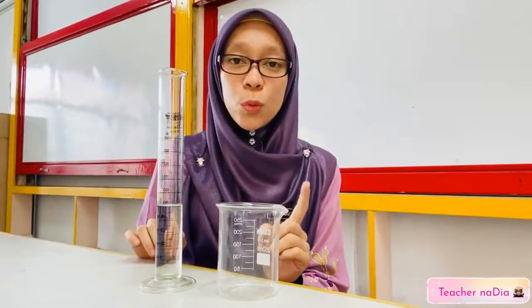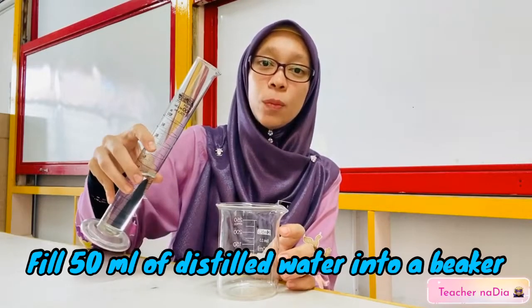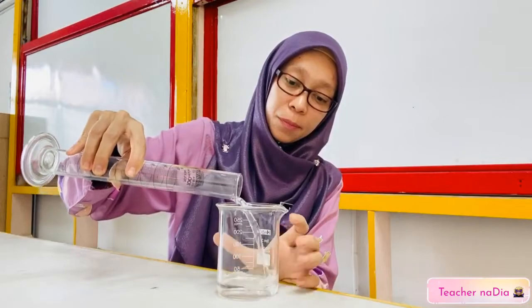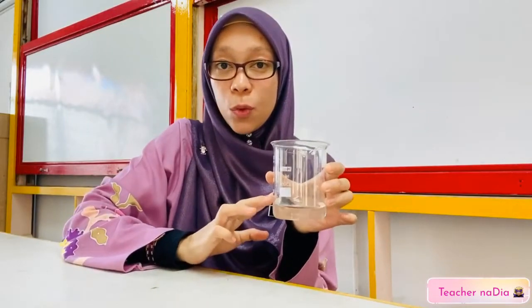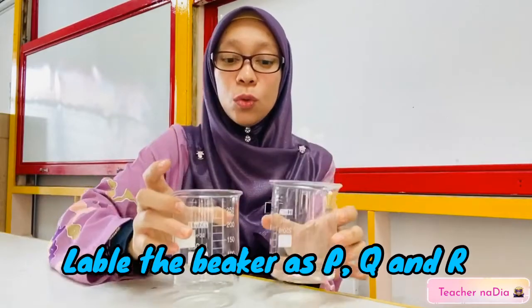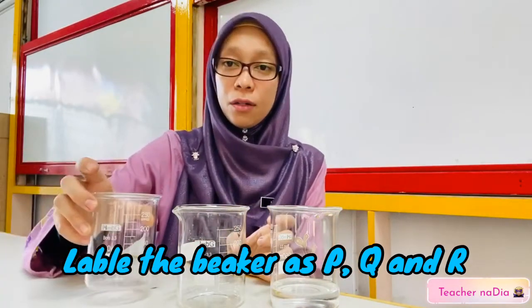First we add 50 ml of distilled water into a beaker. After you have added the water into the beaker, you label the beakers P, Q and R. So you have 3 beakers filled with 50 ml of distilled water.